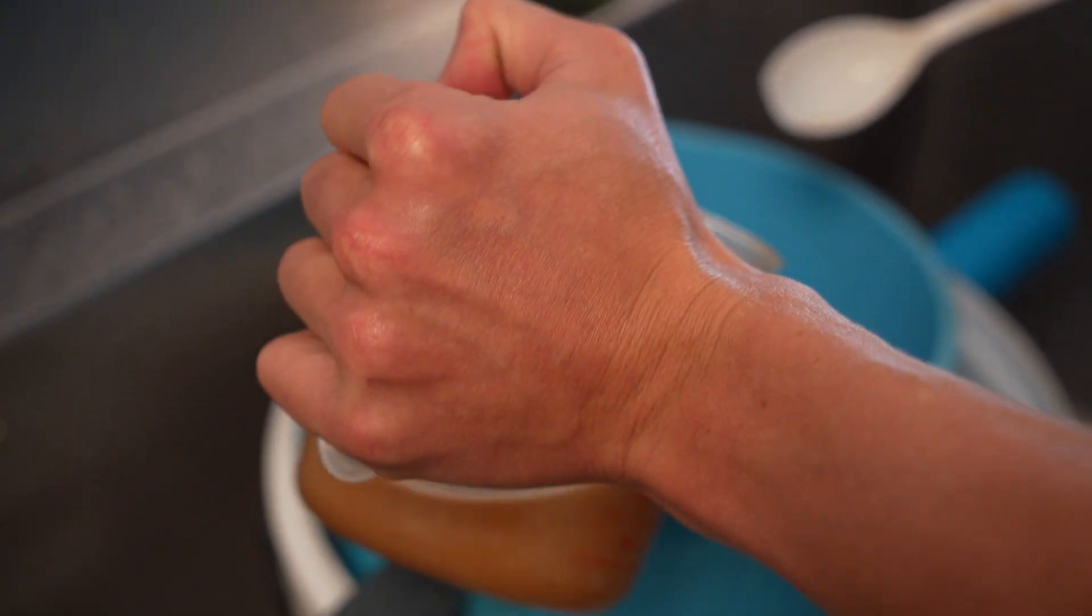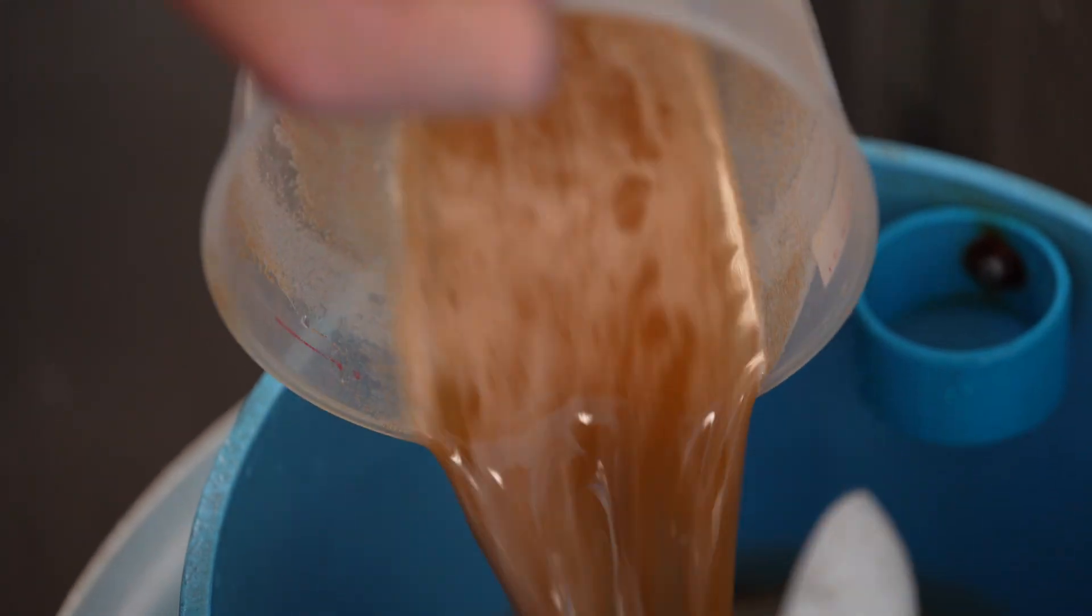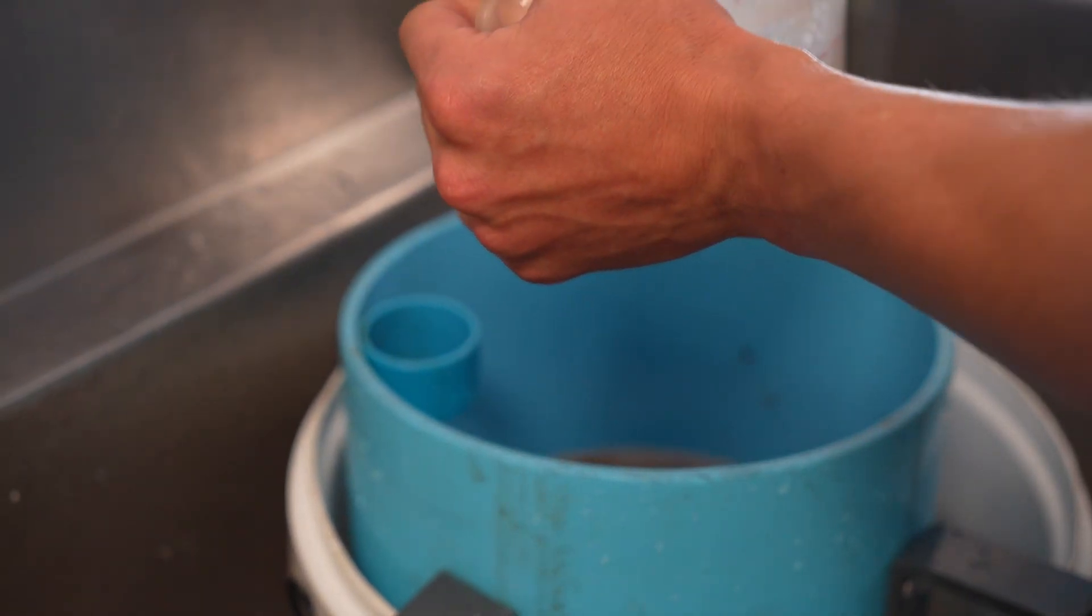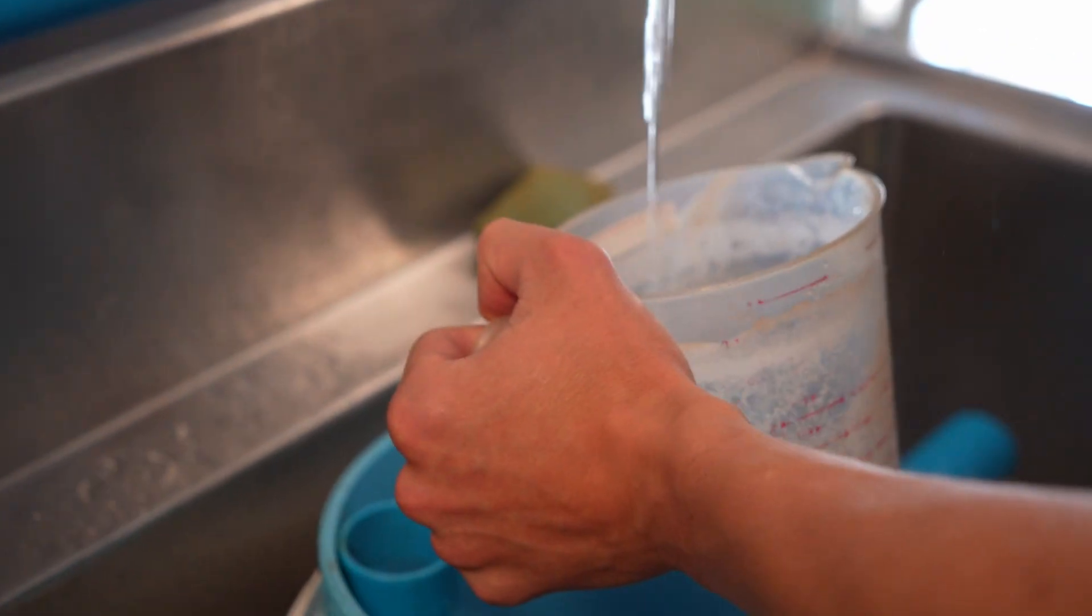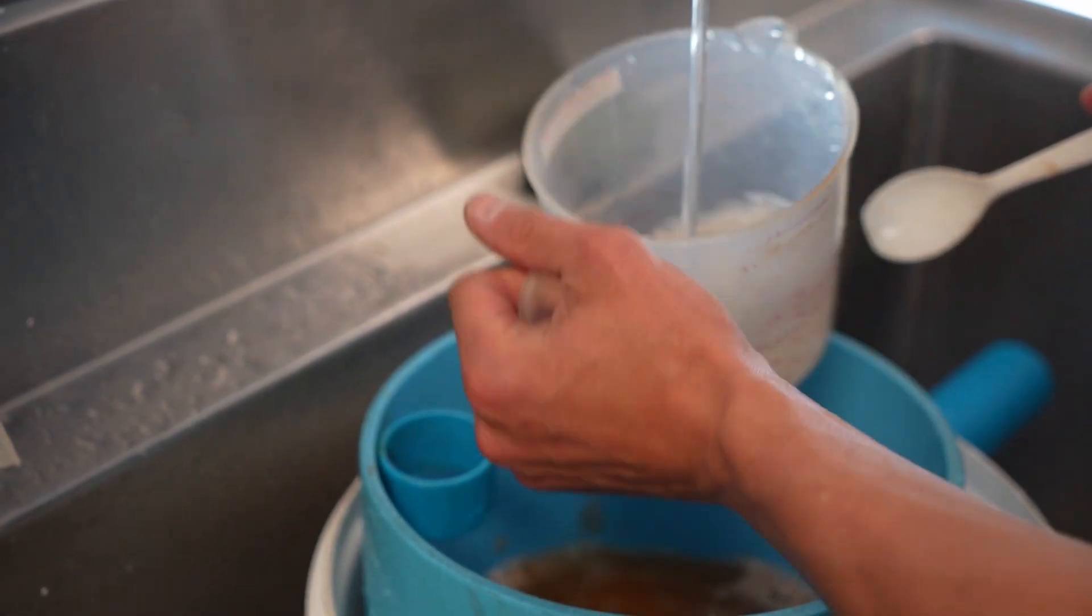So now from here, we're going to pour it over into our sieve. And the goal here is just dilute it, get as much of the eggs out as we can. We don't want to waste anything.